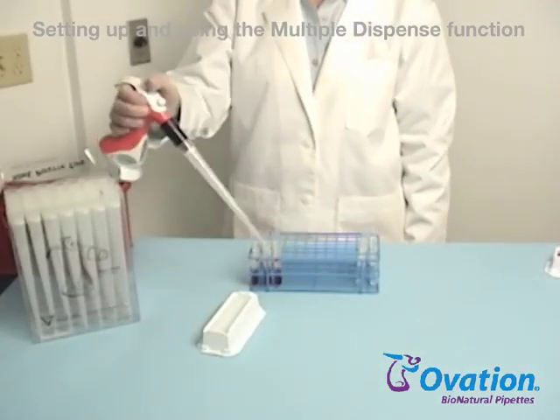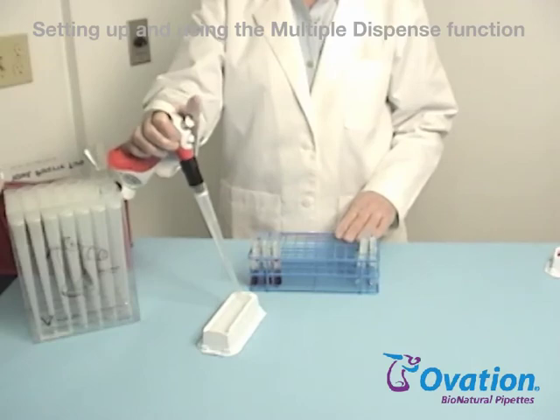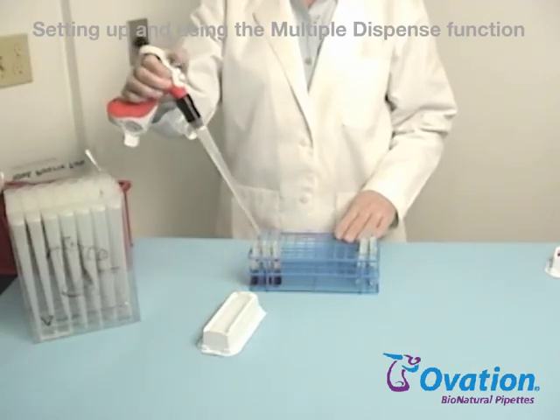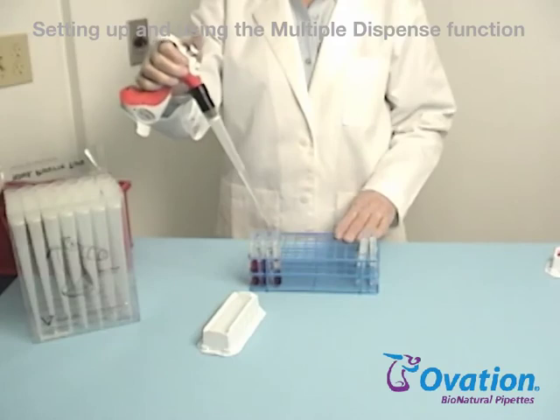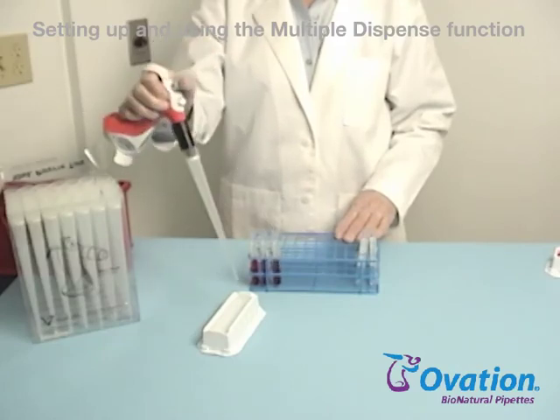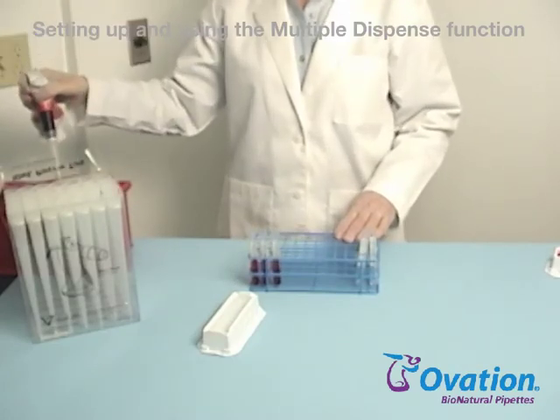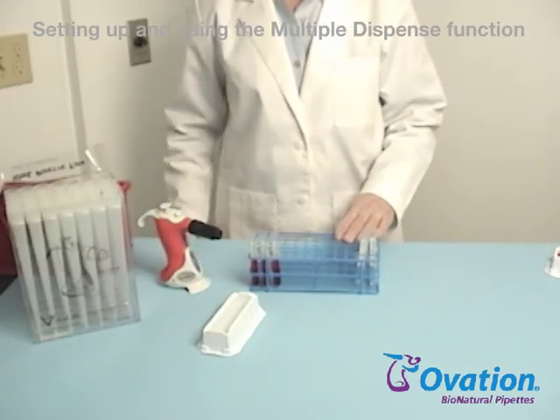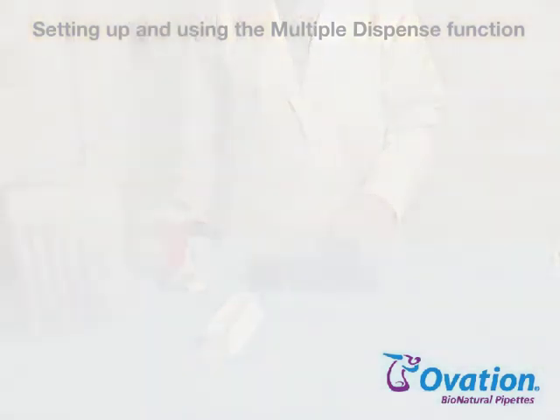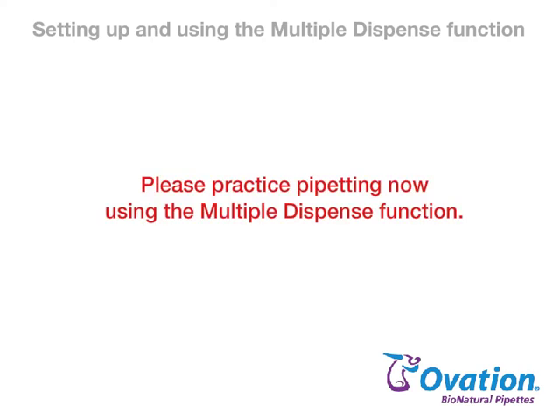Here's the multiple dispense function in use. Please practice pipetting now using the multiple dispense function.